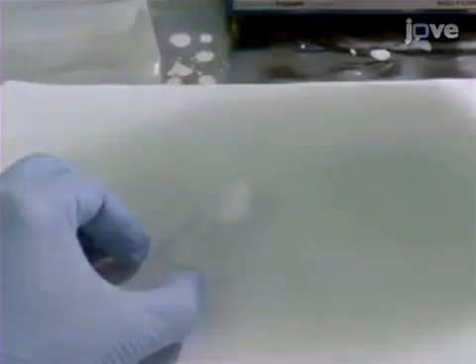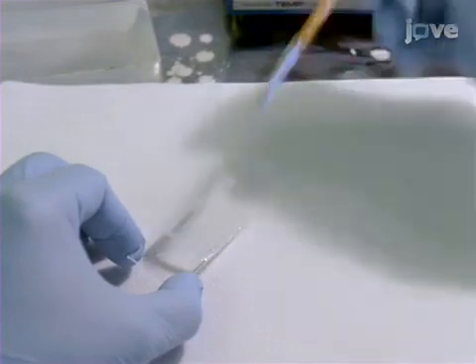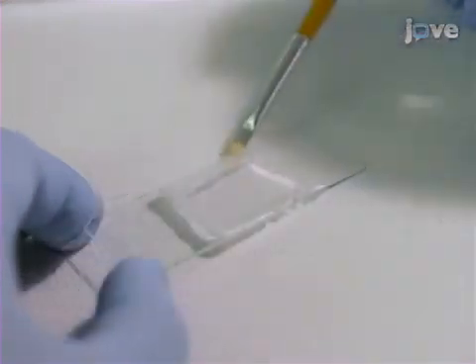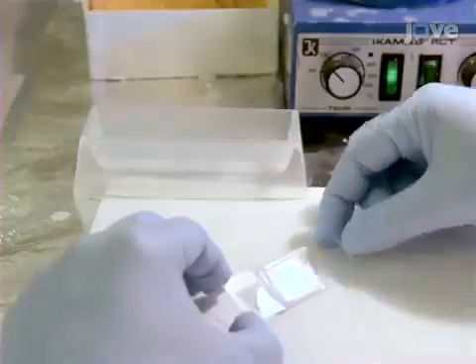For the migration chambers, rapidly brush two layers of melted paraffin wax petroleum jelly mix to the middle of a glass slide. Add a cover slip and seal with two layers of the paraffin wax petroleum jelly mix.